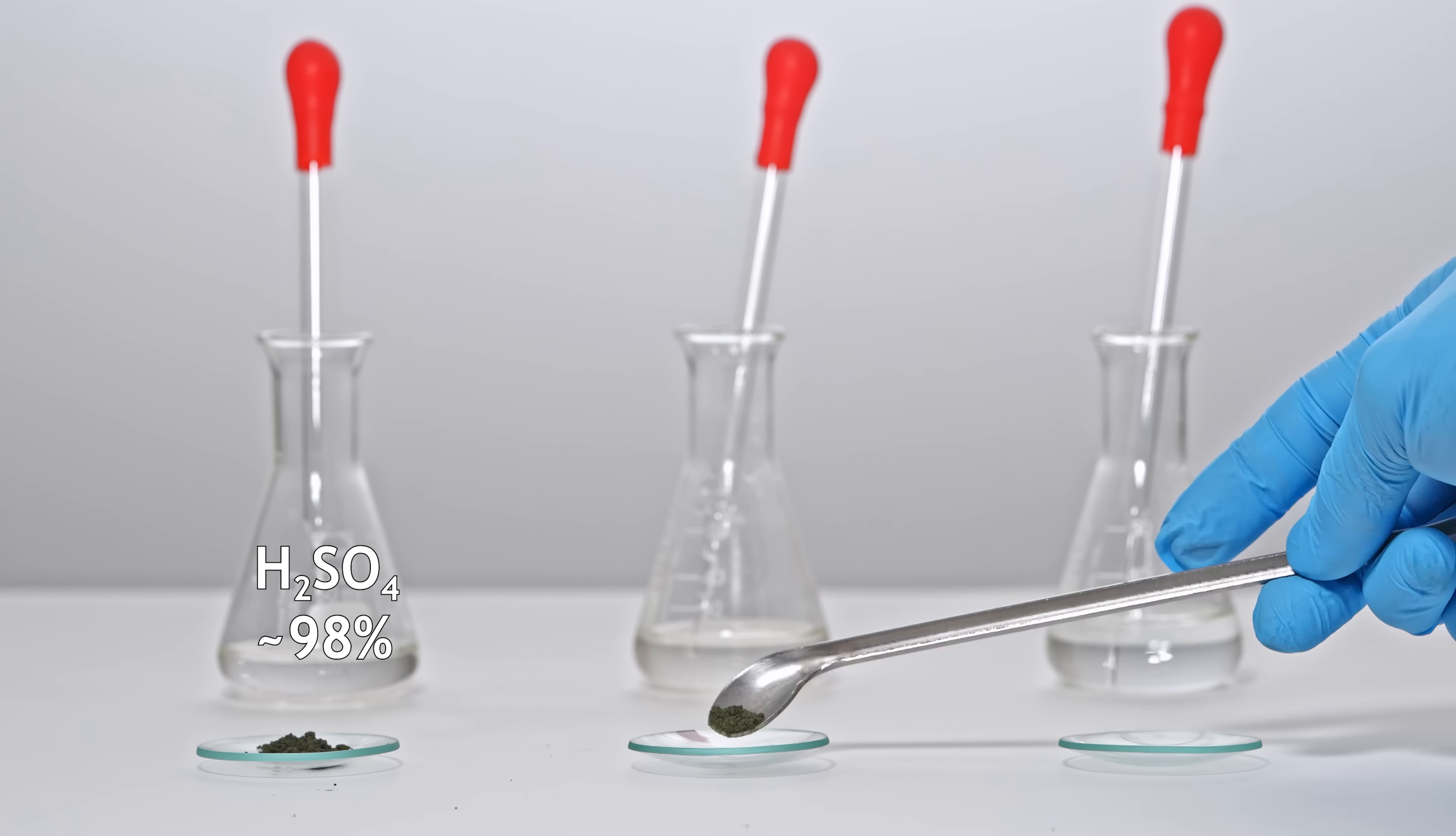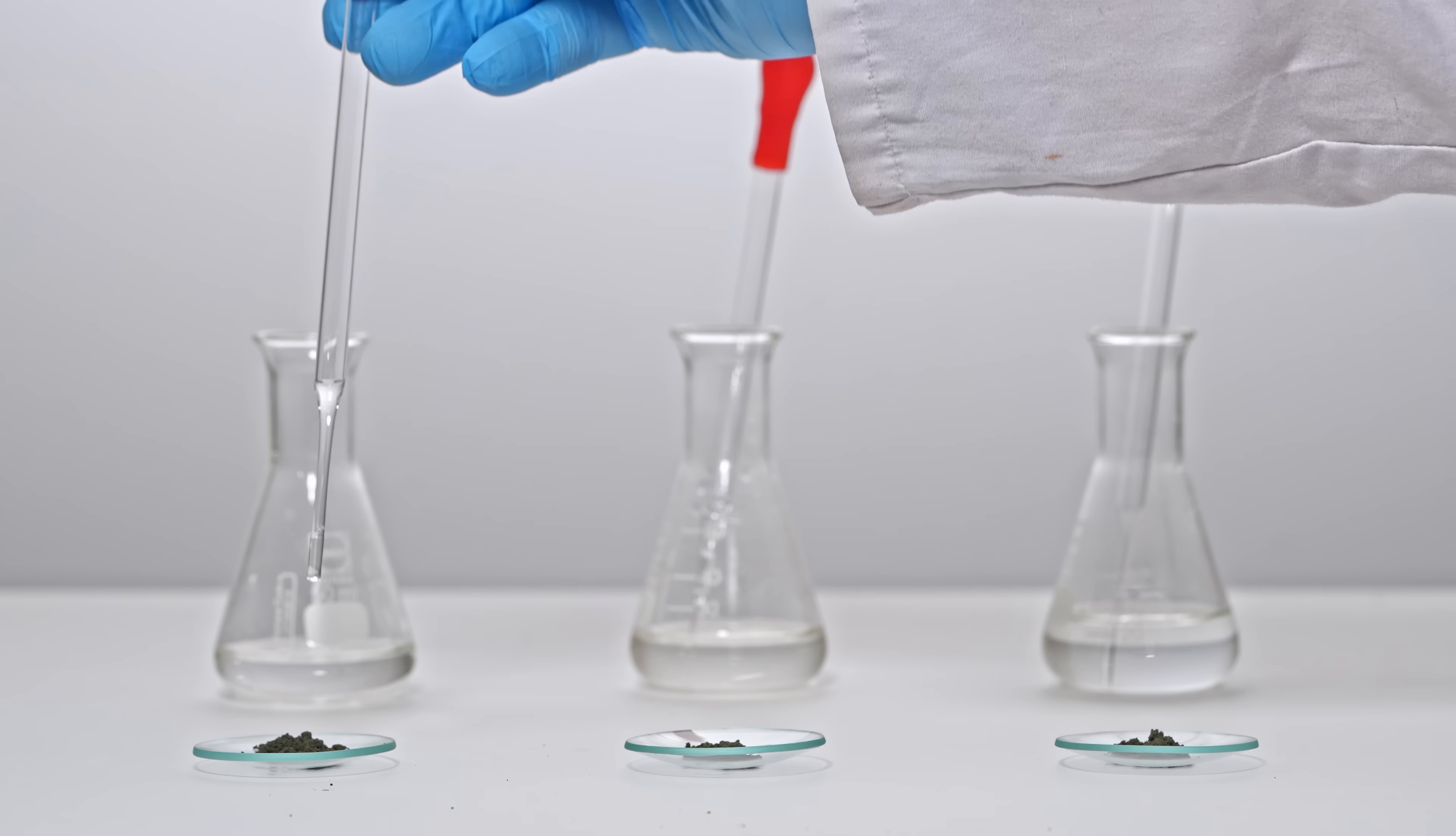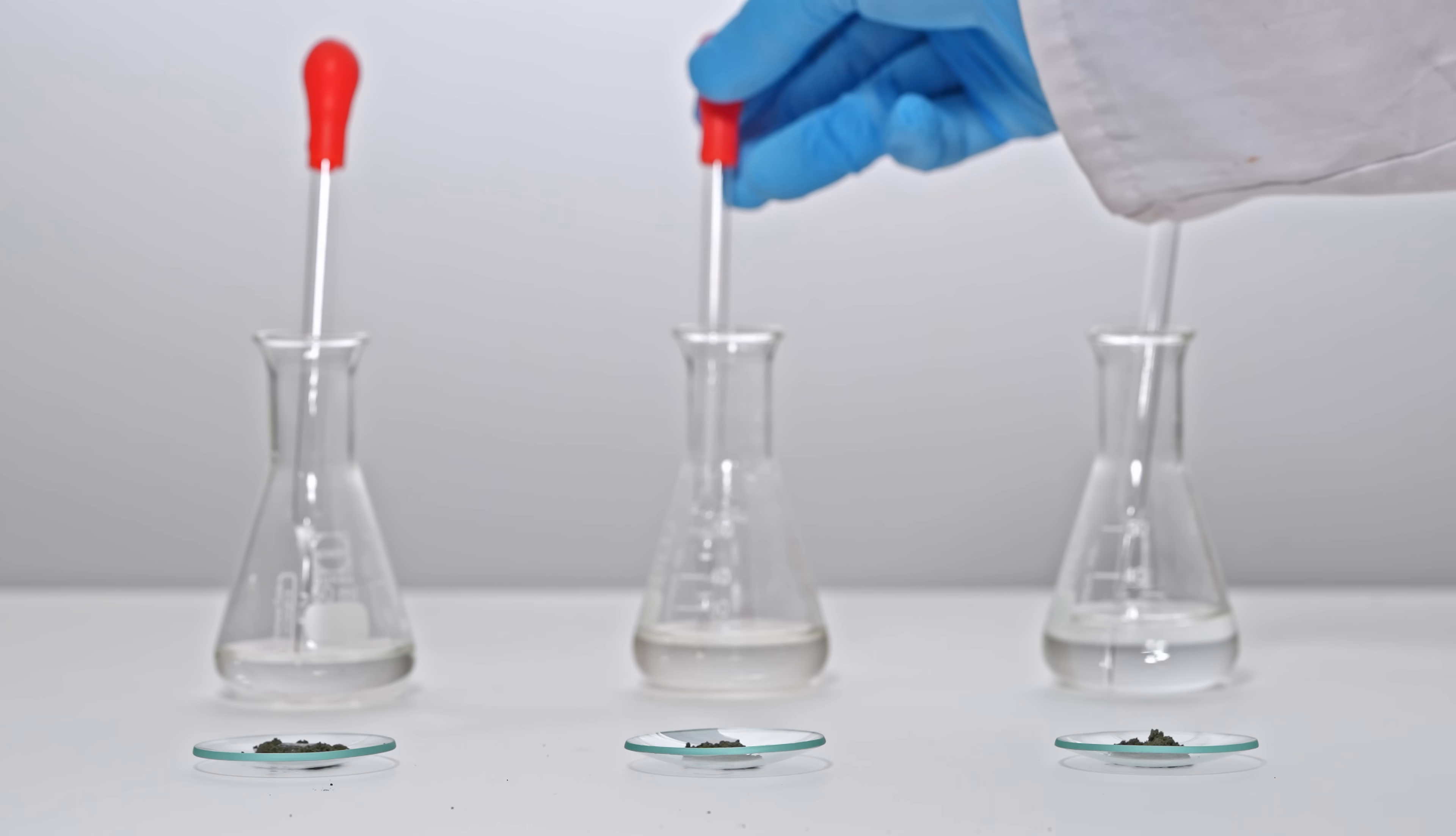Now let's see how it reacts with strong acids. With concentrated sulfuric acid, nothing happens, but one drop of concentrated nitric acid makes it ignite instantly. Really spectacular!